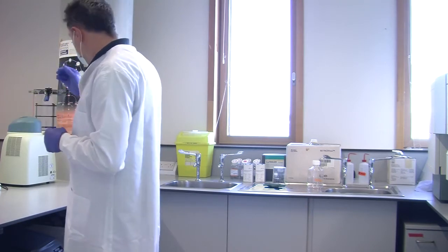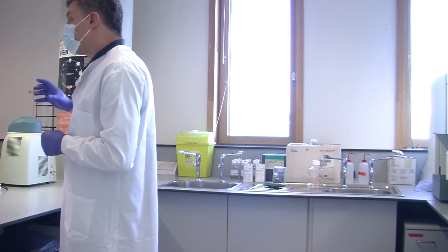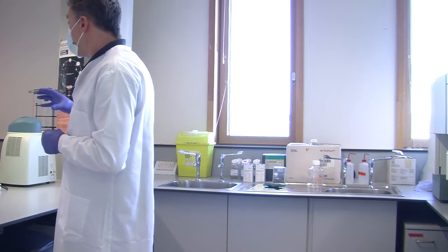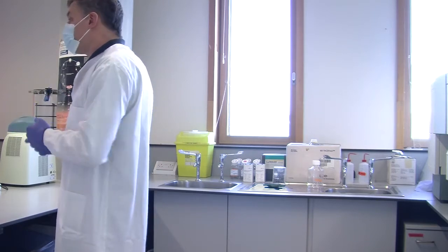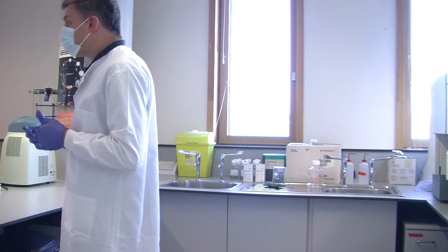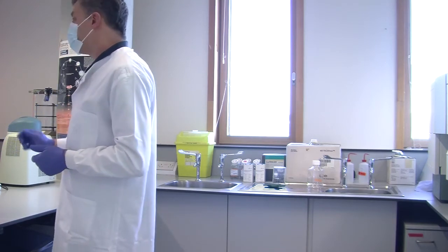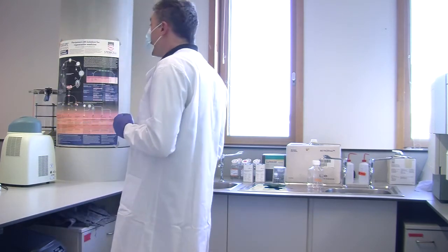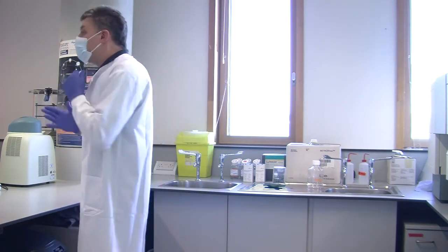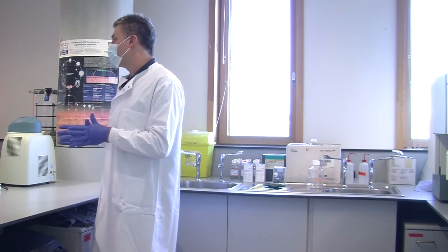And so they can look at the number, or the yes, they're okay, or no, they're not, from the software, and they will know immediately that that's okay. But if there's a problem, so there's a blockage, or there weren't enough cells, or the blood was contaminated, or something, they'll pick it up and go, no, we're going to have to redo this one. Can the software work that out? Not always. So the software is quite good at spotting problems, but it's certainly not infallible.